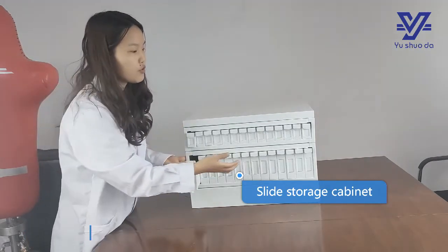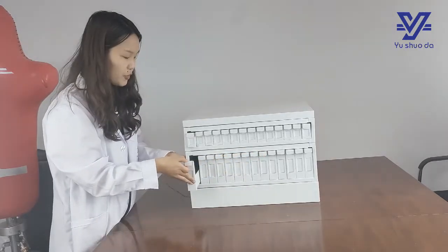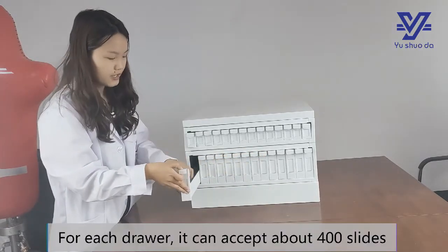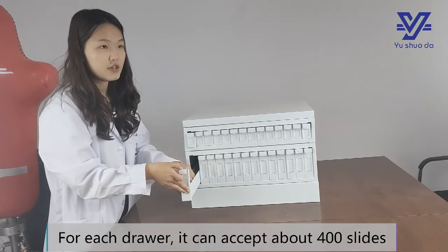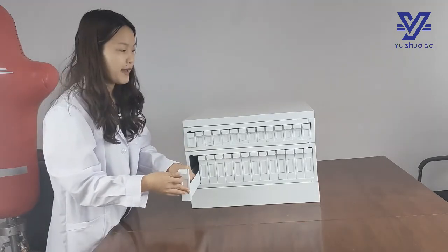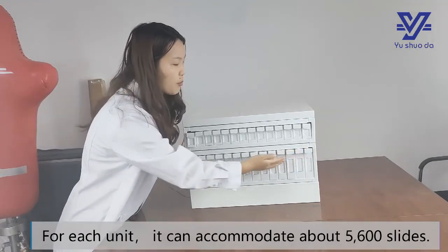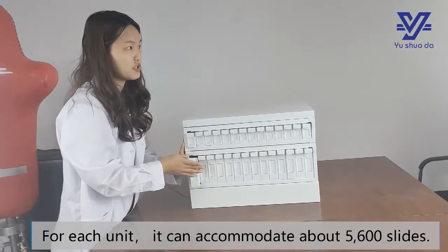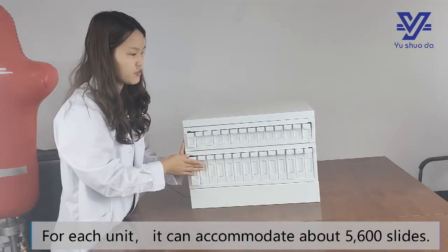The third part is the slide storage cabinet. It also consists of 14 drawers in one unit. For each drawer, it can accept approximately 400 slides, and for each unit, it can accommodate about 5600 slides.